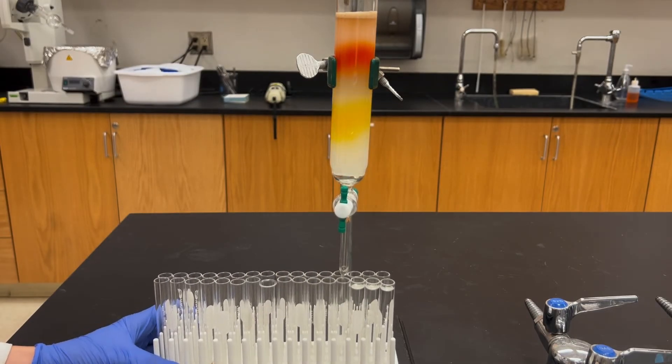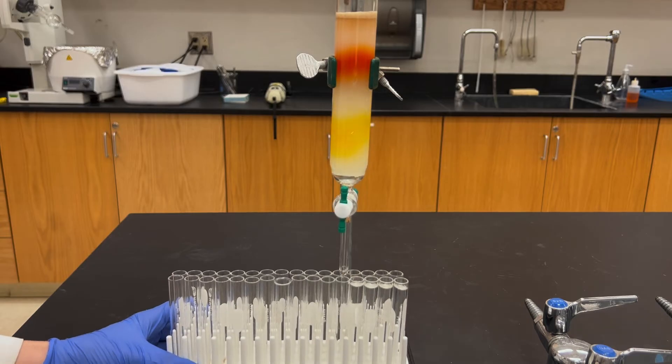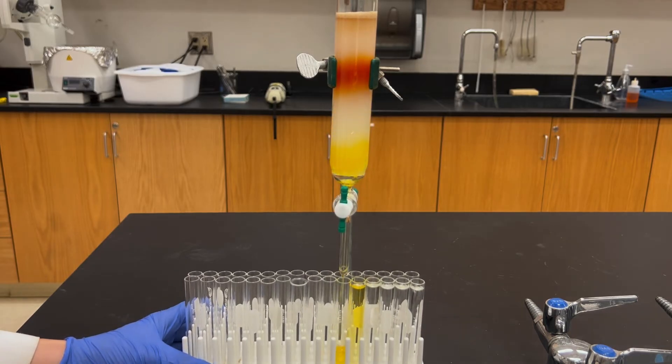I'm going to just keep collecting the fractions and moving the test tubes over to keep on filling one test tube after another.